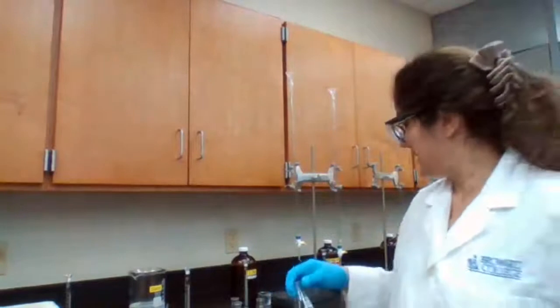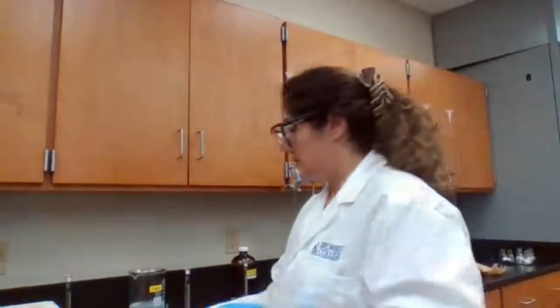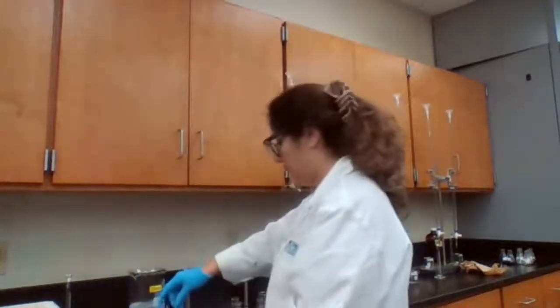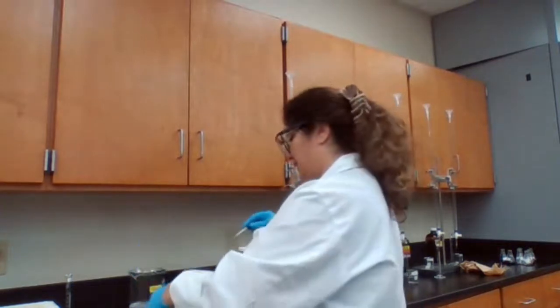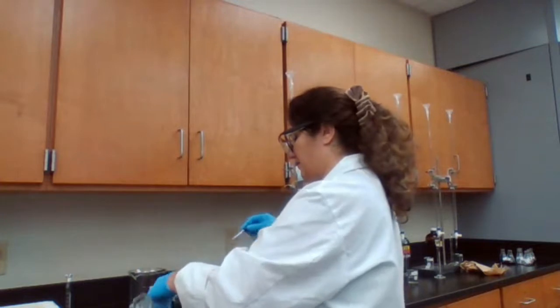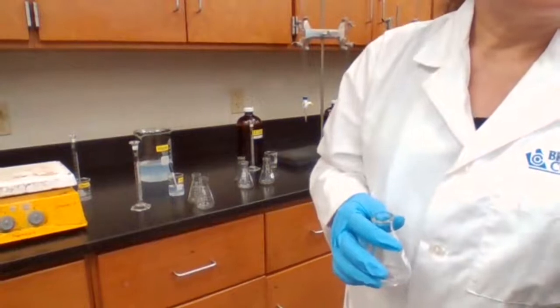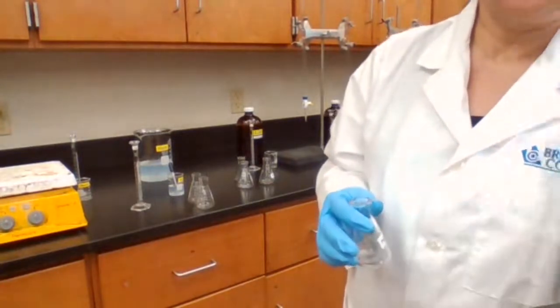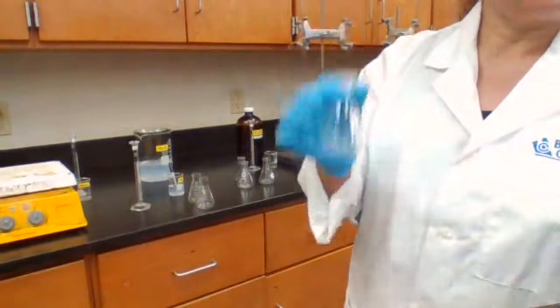Prepare the samples based on the table again, following the table exactly. A5, 1 milliliter of starch, 2, 4, and 4. I've had students who have to repeat experiments actually 5 times because when you rush through getting your sample, you can make a mistake in order or the quantity, and it is not going to work properly, or you won't see the color change at all. You forget the starch. So that's why I'm taking some time trying to prepare my flasks properly.